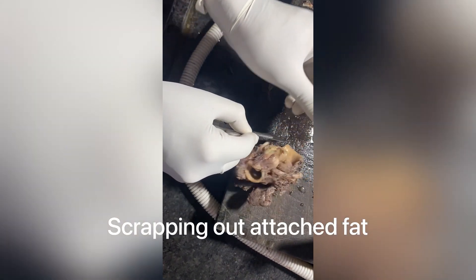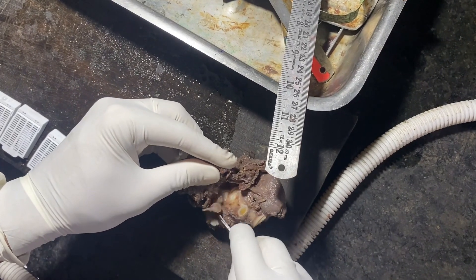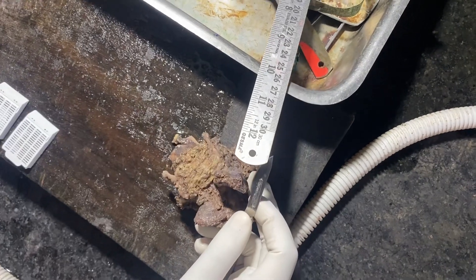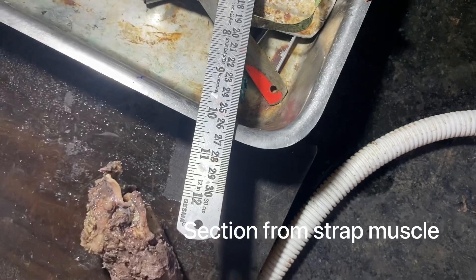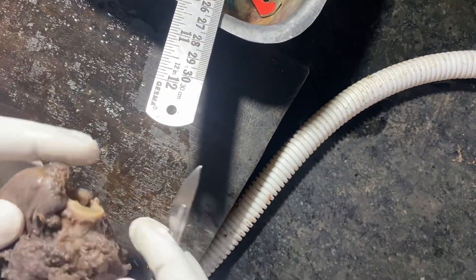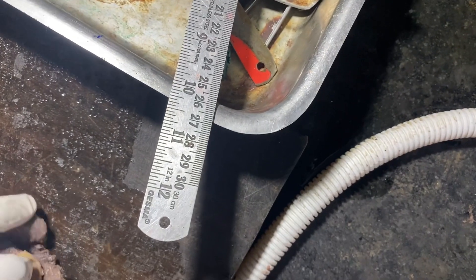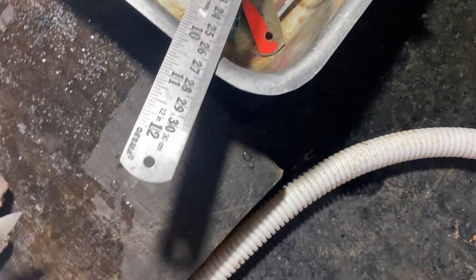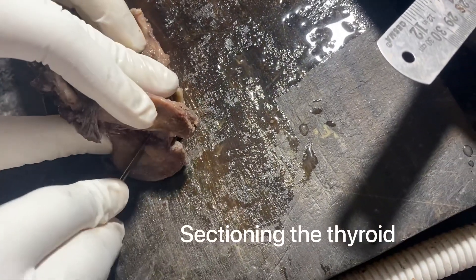The attached fibro fatty tissue, if present, should be scraped out adequately. Next, we are taking a section from the thyroid gland. In this case, one lobe of the gland was present and there was no gross abnormality seen, so we have taken a single section from the thyroid.